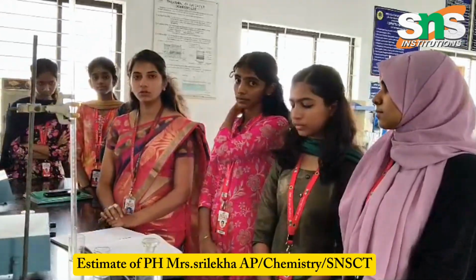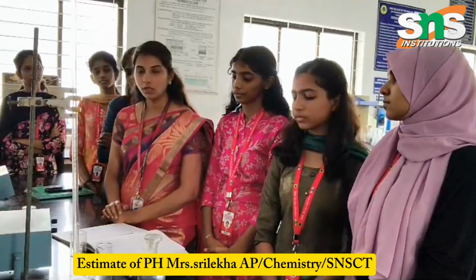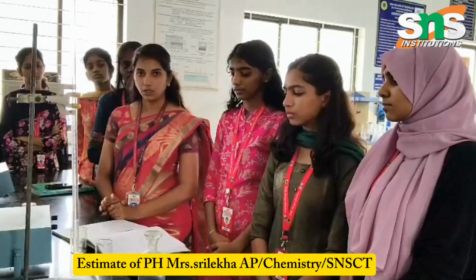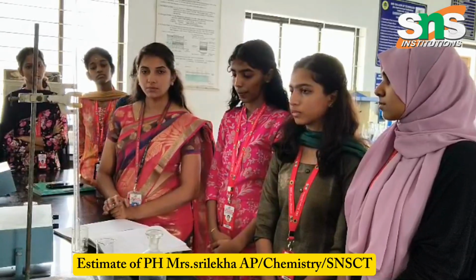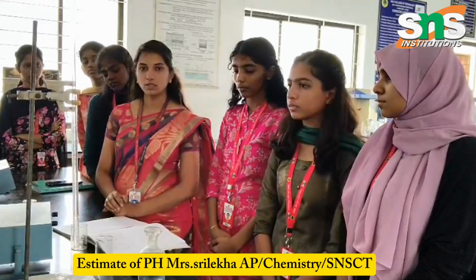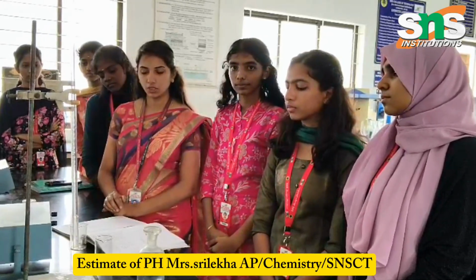Today I am going to talk about the topic of a DT-based video on estimation of the pH in a water sample by pH meter. So the aim of this experiment is to estimate the hydrochloric acid; the water sample contains the HCl solution.